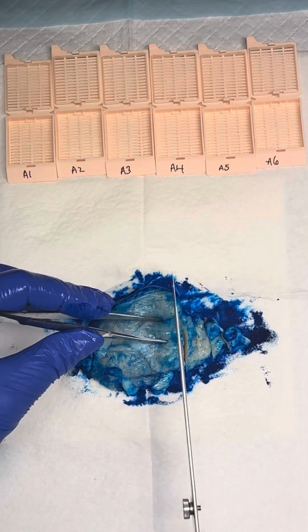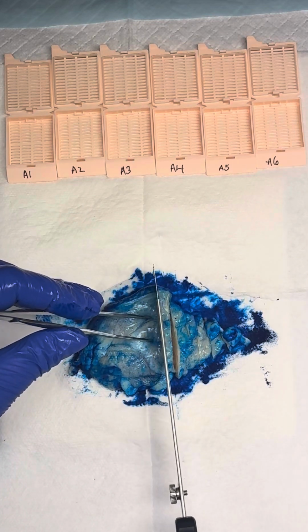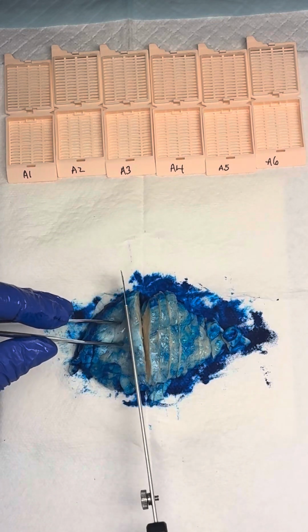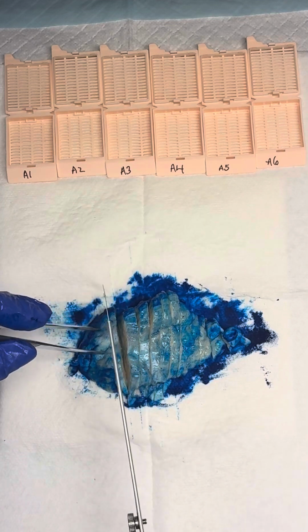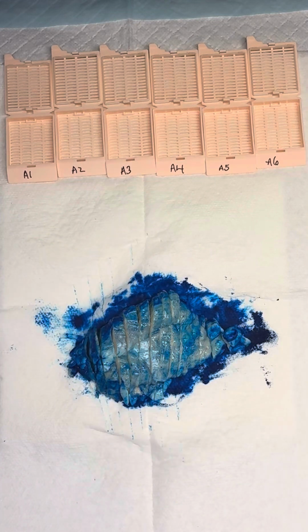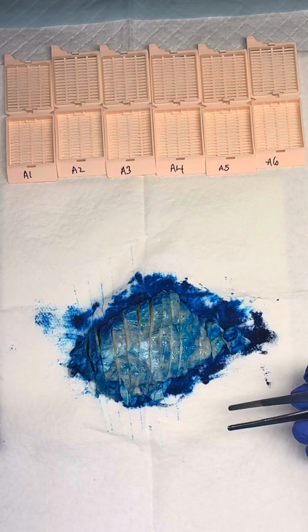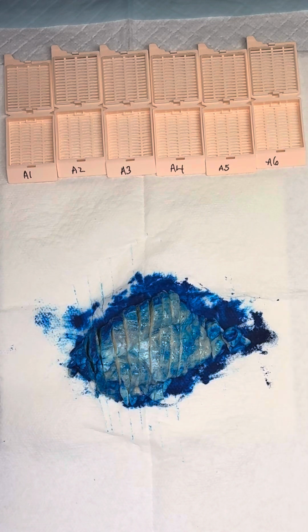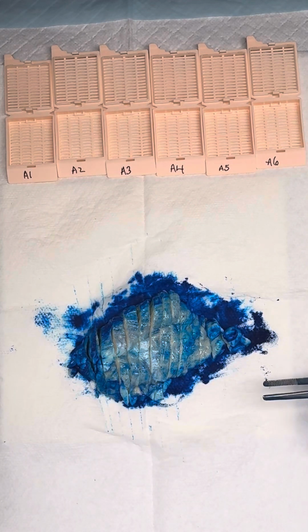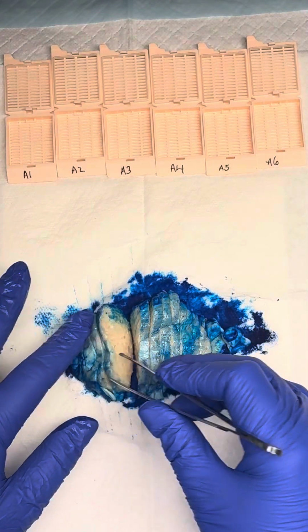So the things that we're looking for on our cut surface, depending on what we receive this specimen for, if we're thinking of a thymoma, we're going to be looking for those thick fibrous bands running through our cut surface of our lesion, versus if we have a thymic carcinoma, then we're not going to be concerned about the fibrous bands. Those don't exist in our thymic carcinomas. Our thymic carcinomas are going to be much more invasive and they're going to lack those fibrous bands. So at this point, we're going to pretend that our thymoma or our lesion is completely involving our cut surface, which is pretty common with thymomas.